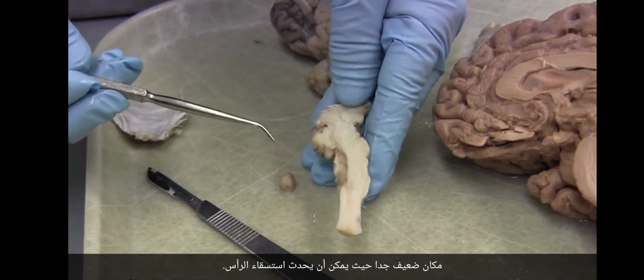And so any interruption, any blockage, if we block that third ventricle, which is really easy to close if there's any pressure, then the CSF backs up, and now there's too much CSF. The choroid plexus keeps pumping, there's no way to drain it, and that causes hydrocephalus.